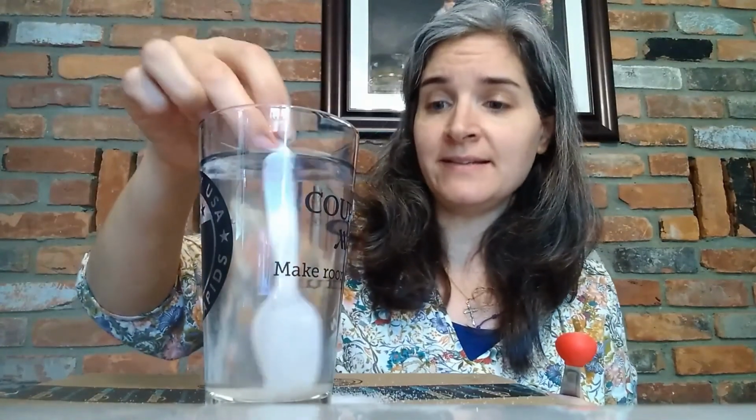And actually I will include a plate that can get thrown out after this that we can pour the salt over so that we're not making a mess on our table. And we're going to do this 6 times. So you can let this video run as I do it, or you can stop it and pause it and just do it with the class. Whatever my great sub would like to do is fine.